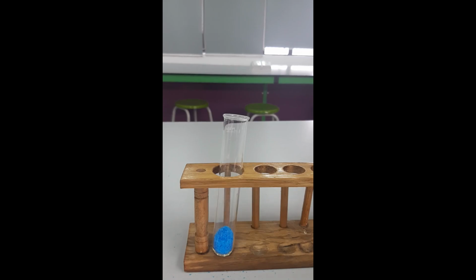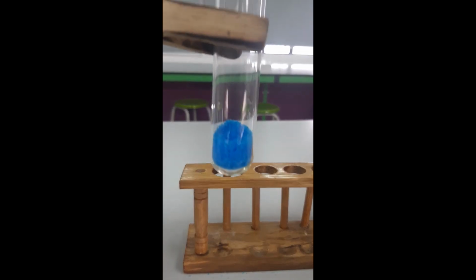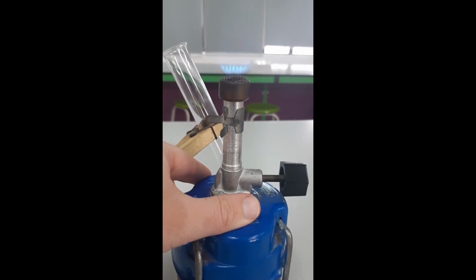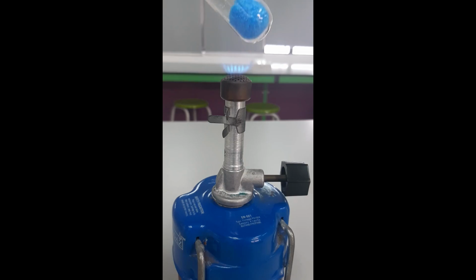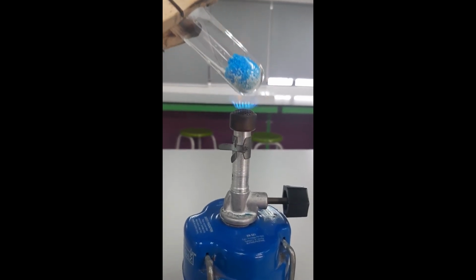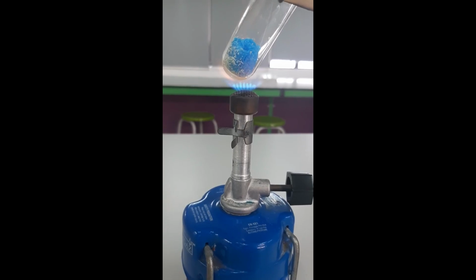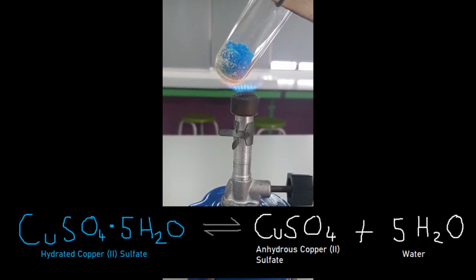Okay, so the first thing that I'm going to do is heat the copper 2 sulfate. If you heat a hydrated crystal, you are going to remove the water. And this is an example of a reversible reaction. So this can actually be used to test for water, because when it's got water in it, it is this blue color. And when it is dry, you can see it's starting to dry out there a little bit. When it's dry, or anhydrous, then it becomes a white color. So I am just heating it here to remove the water of crystallization. I'll put the equation for that on the screen now.